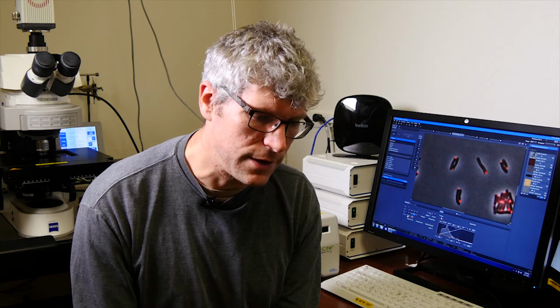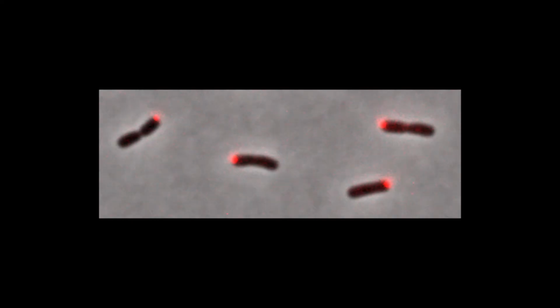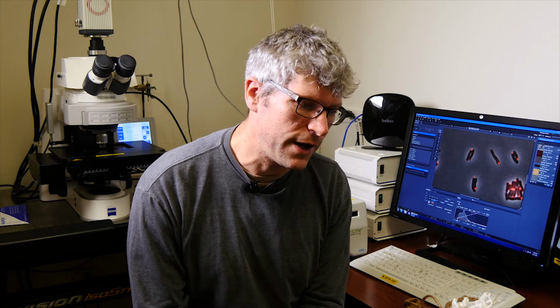And then we ask the microscope to take what's called a time-lapse video image. So we take a picture every few minutes and we watch how those anatomical features change locations over the course of the cell cycle as the cells grow and divide. All of these bacterial species, whether they're pathogenic or non-pathogenic, share a common trait, which is that they're highly organized.